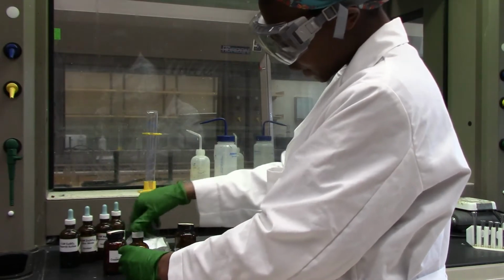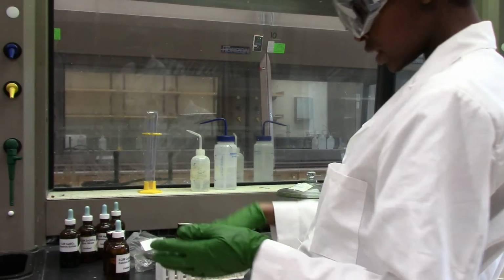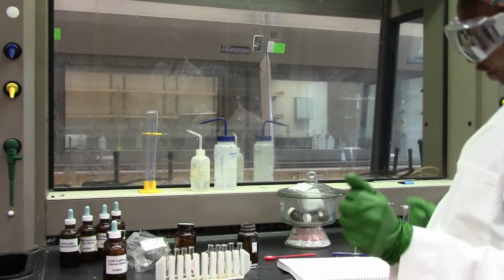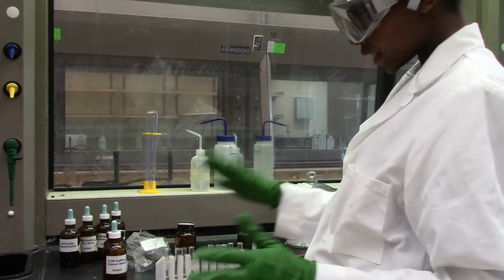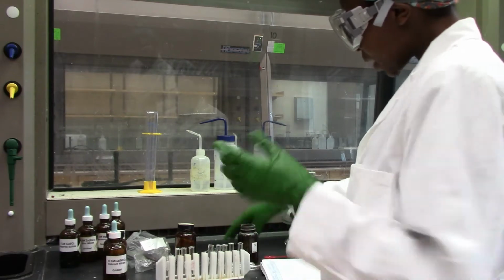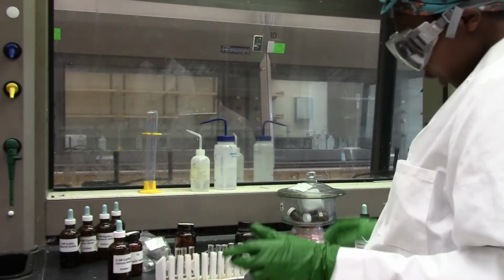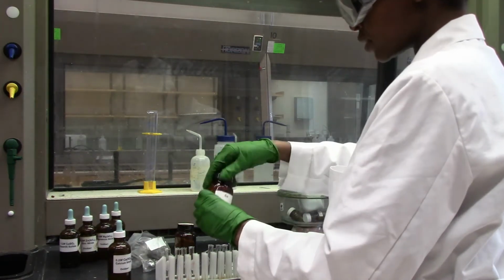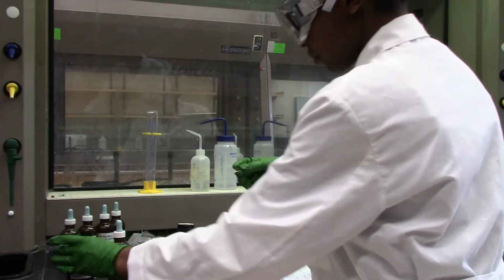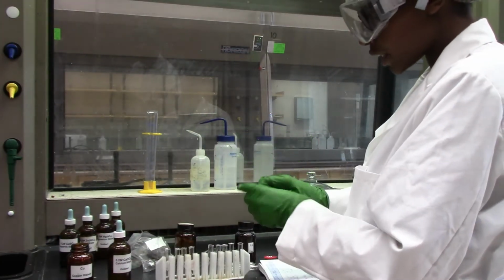Well, one thing I can tell you for sure is that we eliminated calcium in these metal ion solutions, and that should give you a clue of how reactive this metal is. But anyway, let's go ahead and do the same thing. We're going to start with copper this time round and put a tiny bit in our calcium nitrate solution.